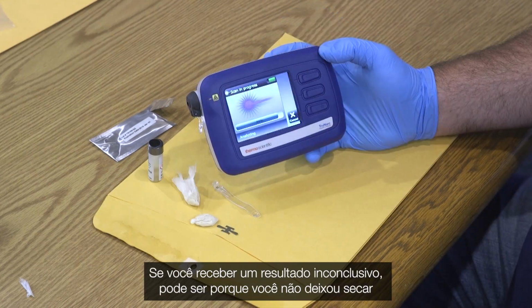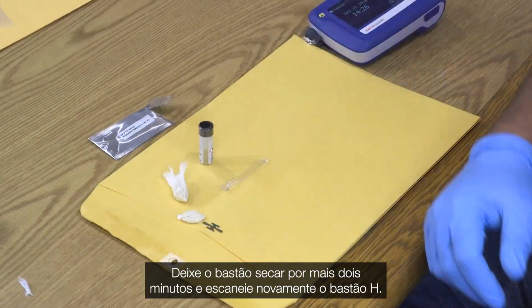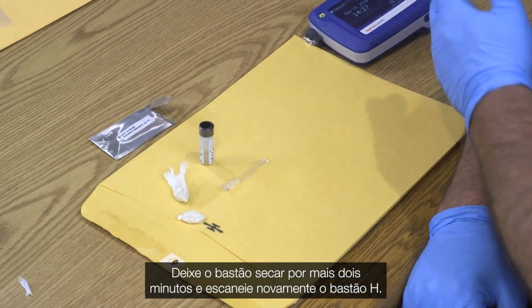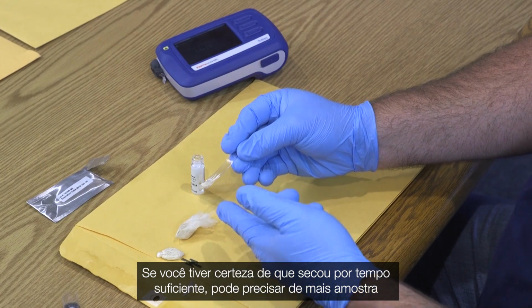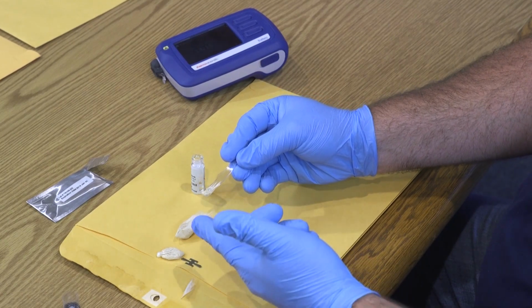If you receive an inconclusive result, it may be because you did not let it dry long enough. Let the stick dry for 2 more minutes and rescan the H stick. If you are confident that it did dry long enough, you may need more sample on the stick.